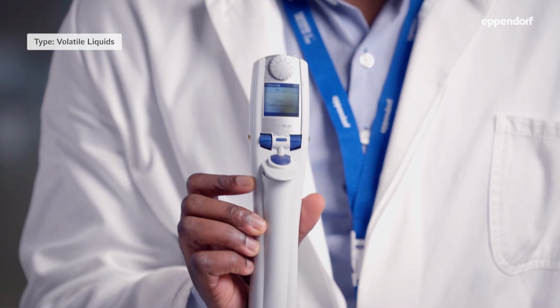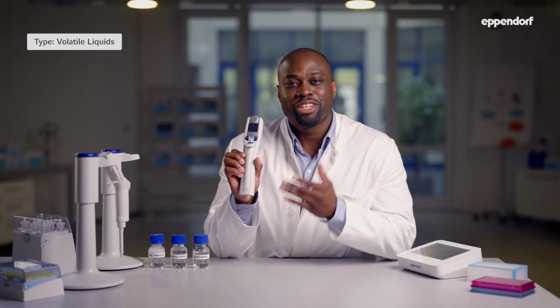However, if you want an easy way to work with volatile liquids, it's best to use the positive displacement tool like the Multipette E3x. You don't need to make any adjustments or change the pipette technique or even pre-wet the tip, because the instrument doesn't have an air cushion to be affected by the liquid.